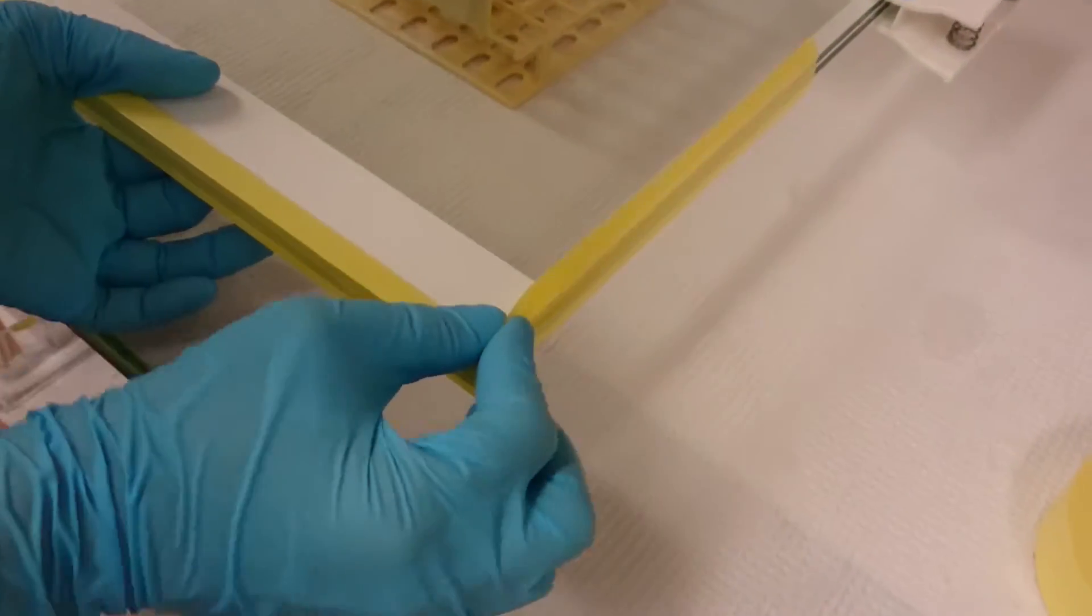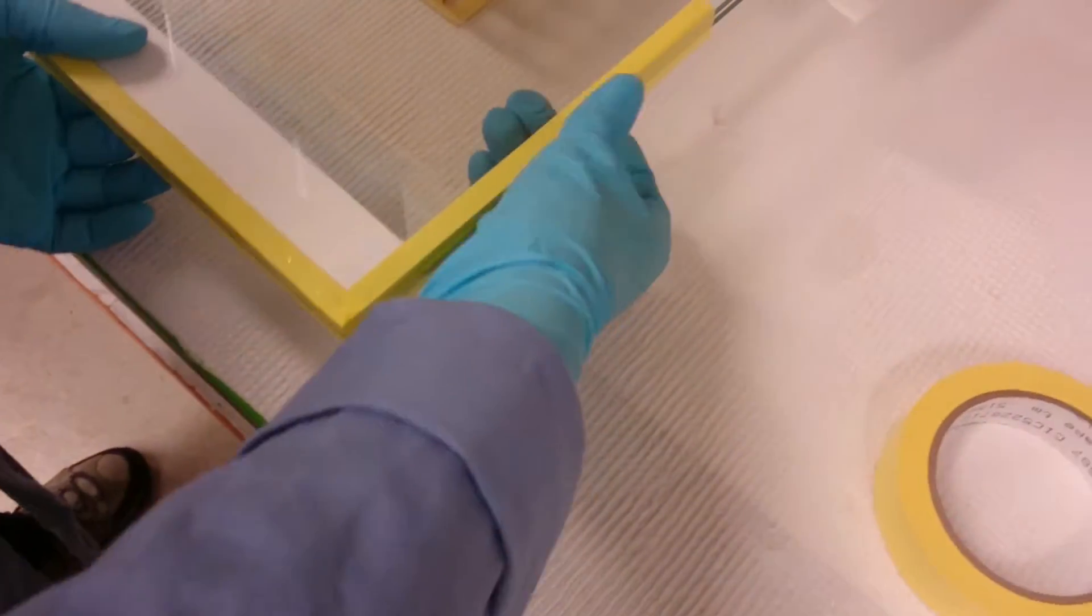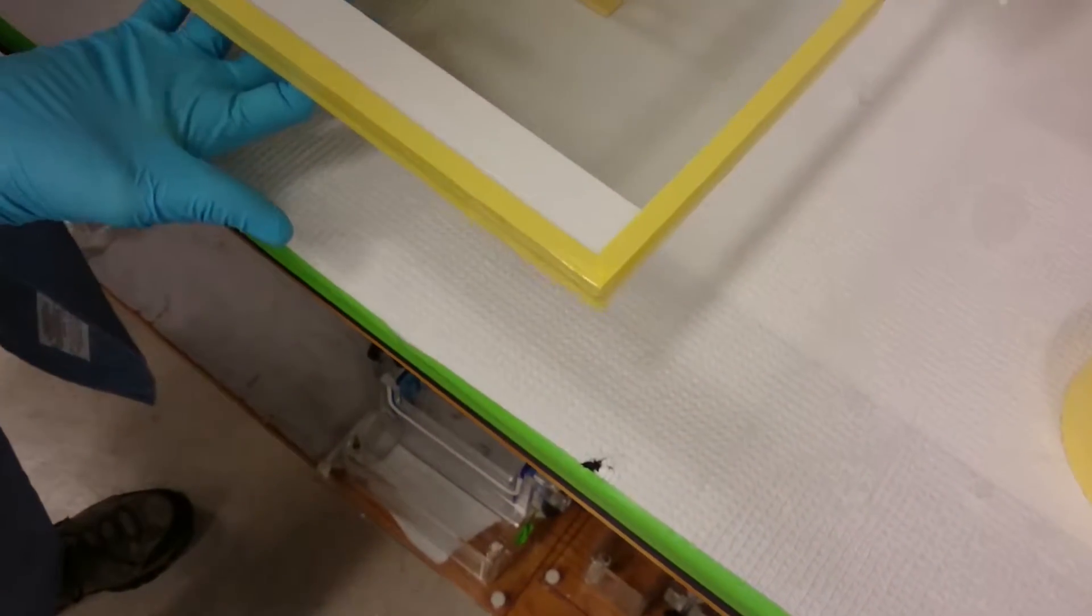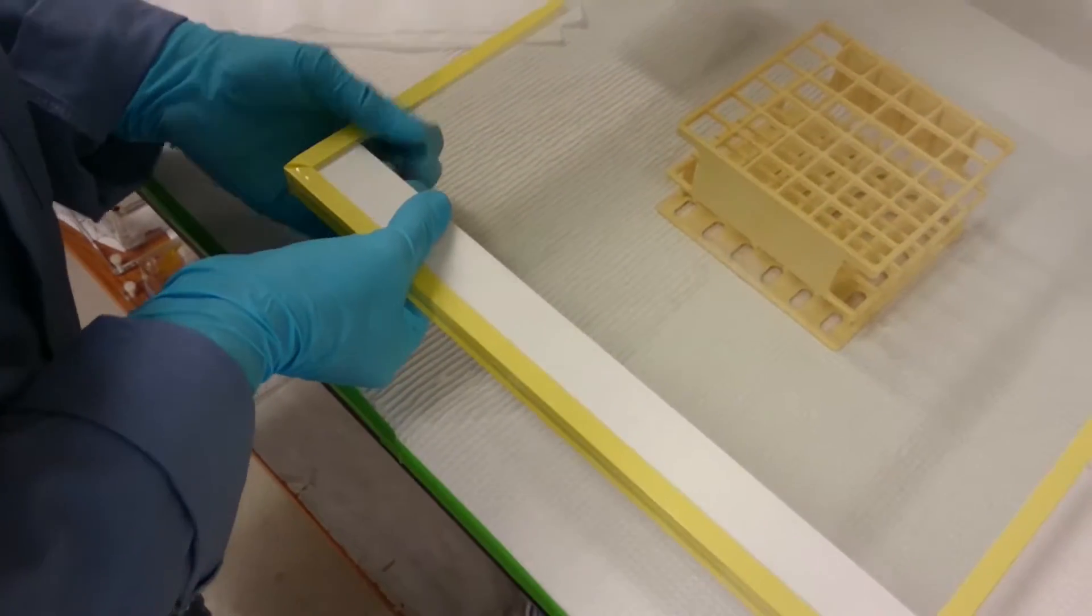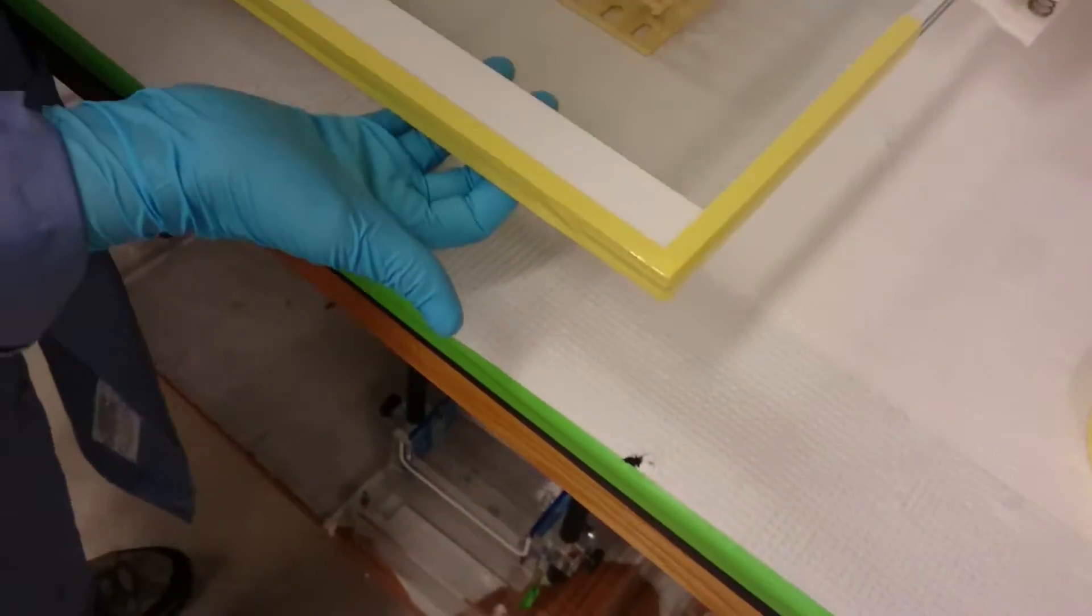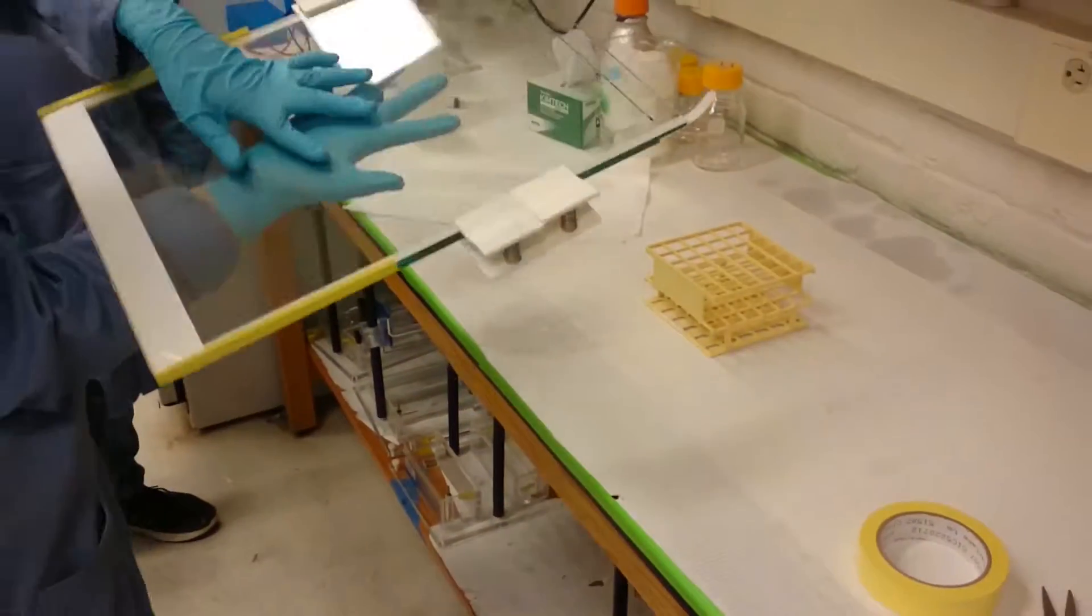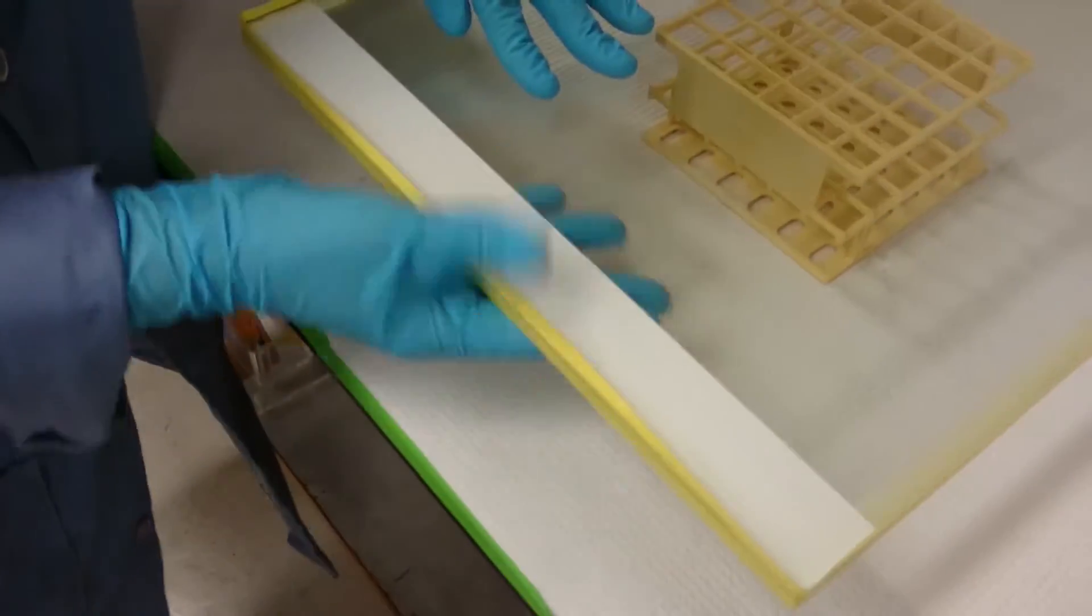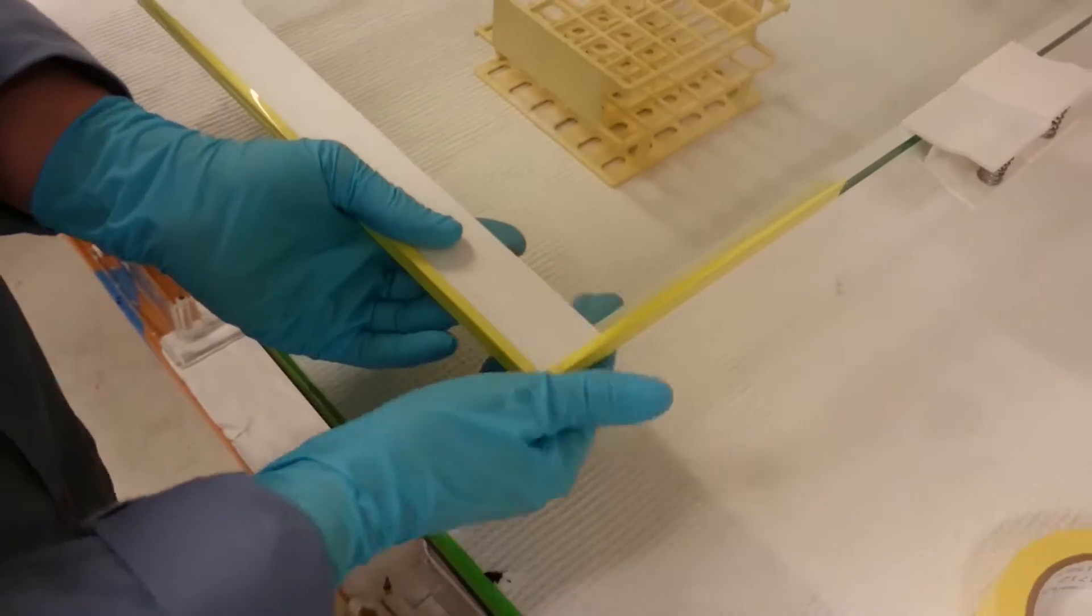And then in the corner, fold it like how your mother showed you to fold your bedsheets, so that it lies nice and flat. Same thing on the other side. Tightly folded corner. So you can see that there are almost no wrinkles along where I just folded it. And so now we need to fold the thinner side, so you can just flip the gel over like that, and do the same thing over here. It's a little bit trickier to fold the corners with the thinner side, but if you practiced on your bed as a kid, it'll be no problem.